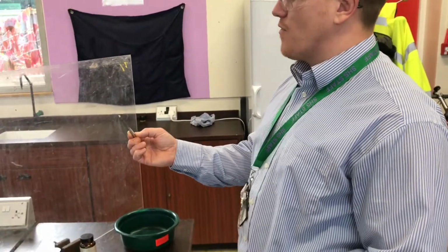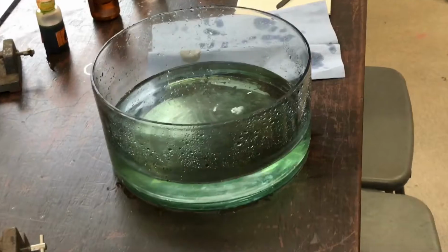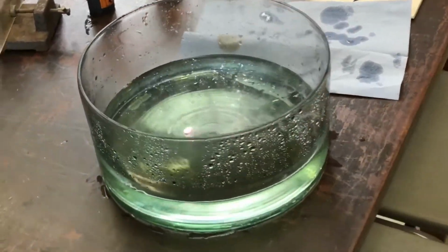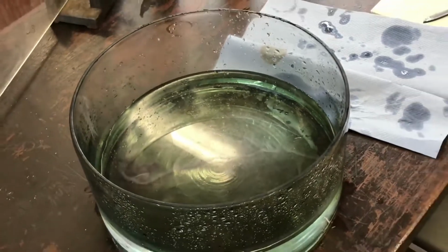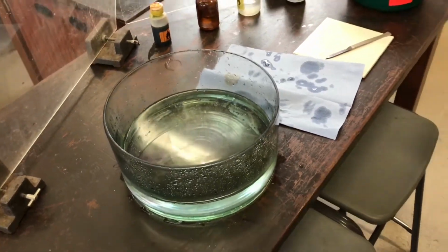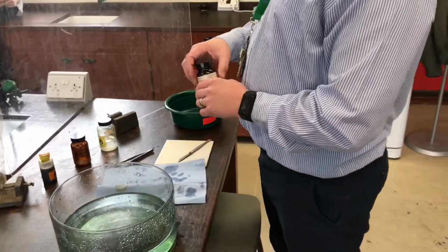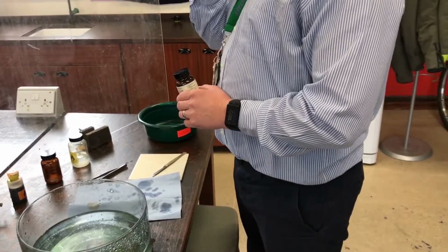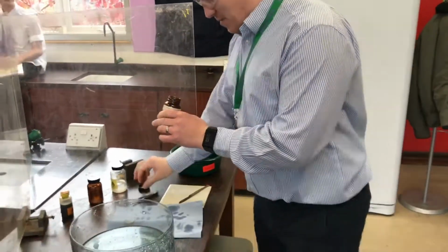Here we go. Let's have a 3, 2, 1. Did you see that little hoop of smoke? Okay, that is it because it was a smaller amount. We've got to keep it a smaller amount, and ensure that we don't use too much.